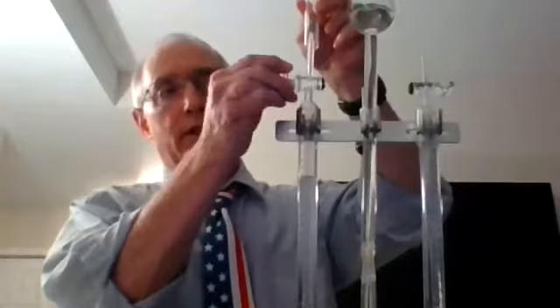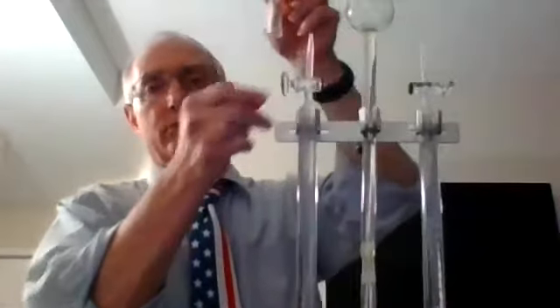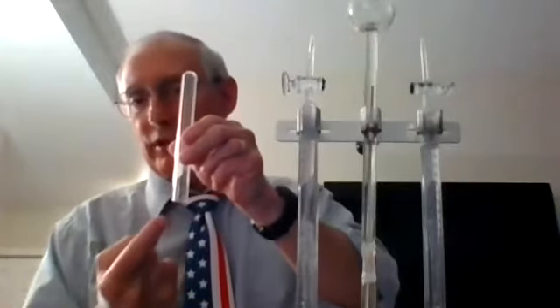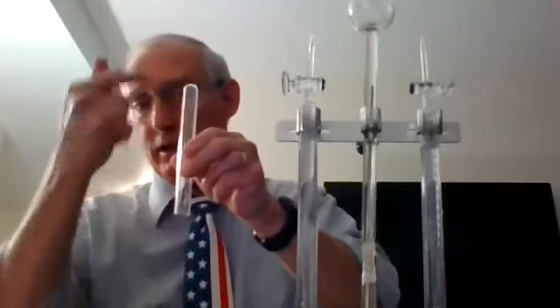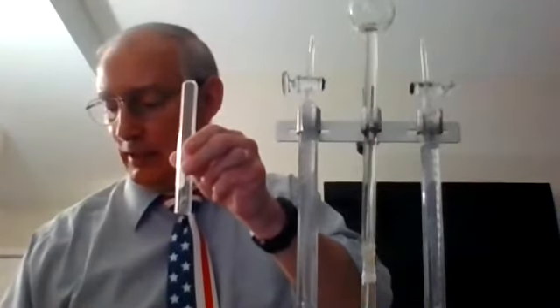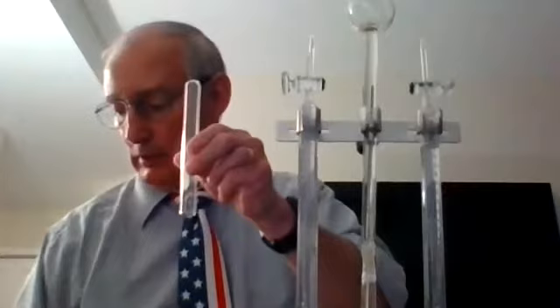Okay, let's stick it in here. That's nice. It's in this nice little test tube. There's all kinds of oxygen available to it right there at the front doorstep. How come that hydrogen isn't naturally, spontaneously combusting? That's the question. We have to give it this thing called activation energy. So let's give it a little bit of activation energy.